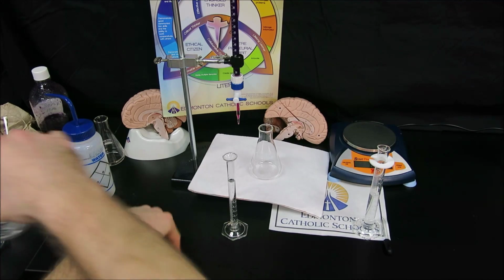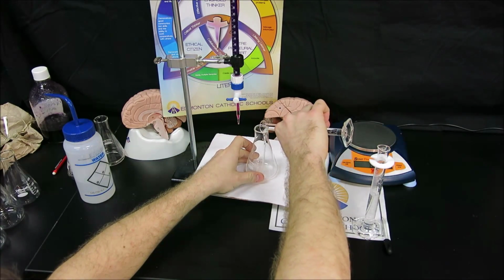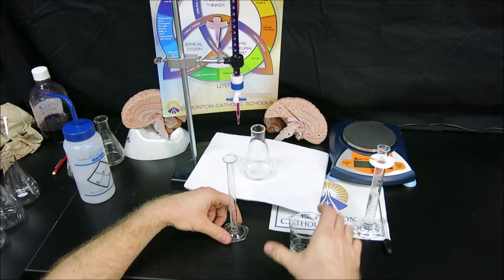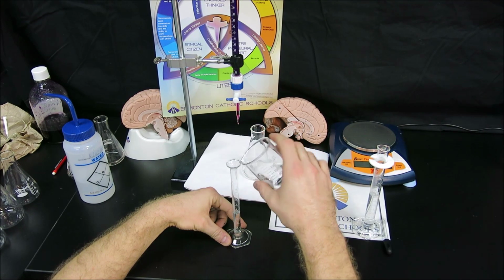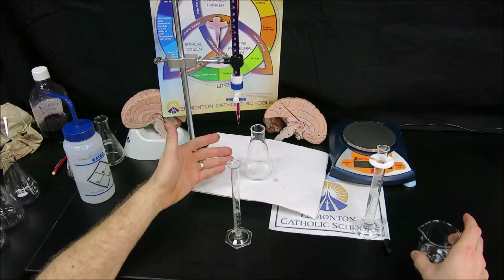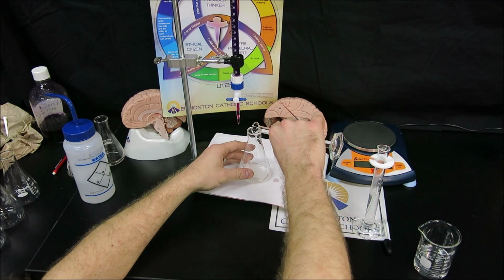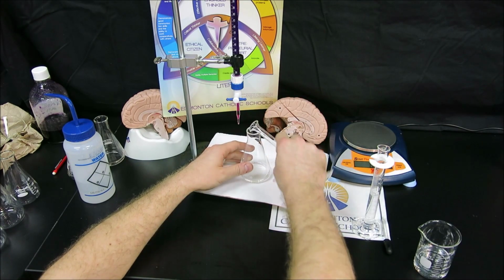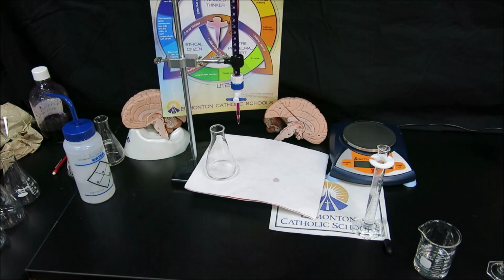And now, in order to make this react, we actually also have to add 5 milliliters of acid. So that 2 mole per liter sulfuric acid, we need to make sure to add 5 milliliters to each one of our trials. Now in this case, if the meniscus is not exactly at 5, it is not a problem because the reaction is using acid as an excess reagent. It's the peroxide that needs to be exactly 10 milliliters.